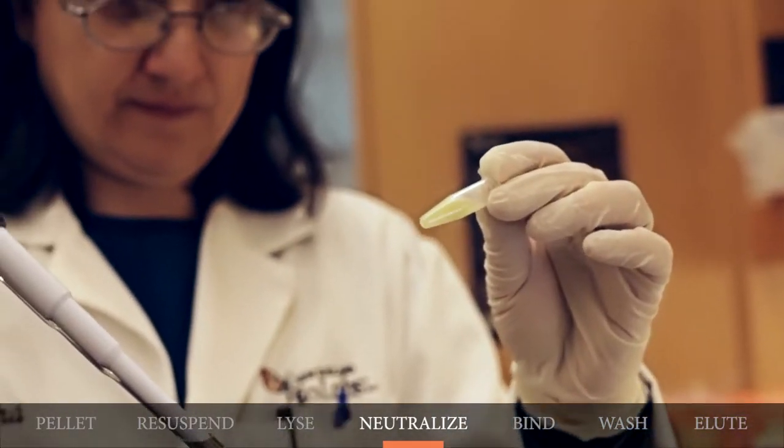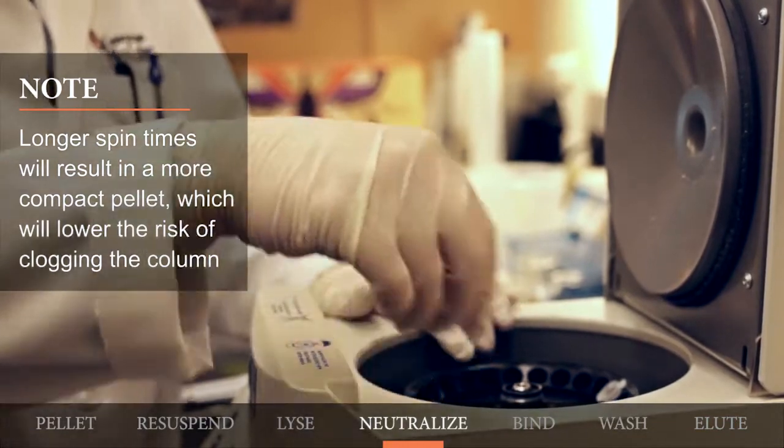Now you will need to incubate for two minutes at room temperature and then you will centrifuge for two to five minutes.